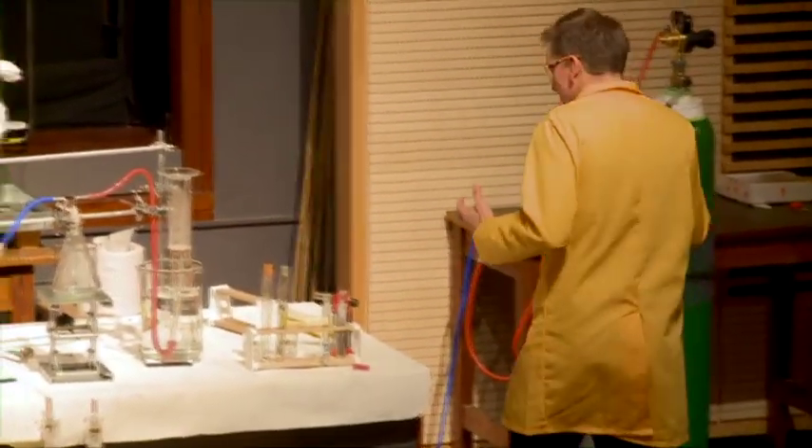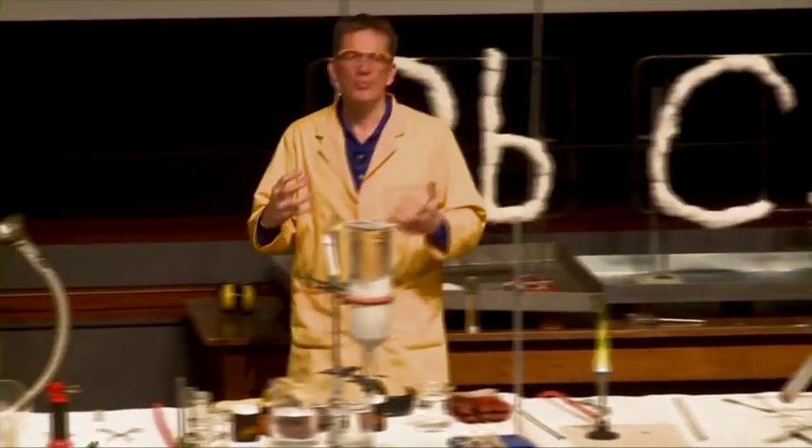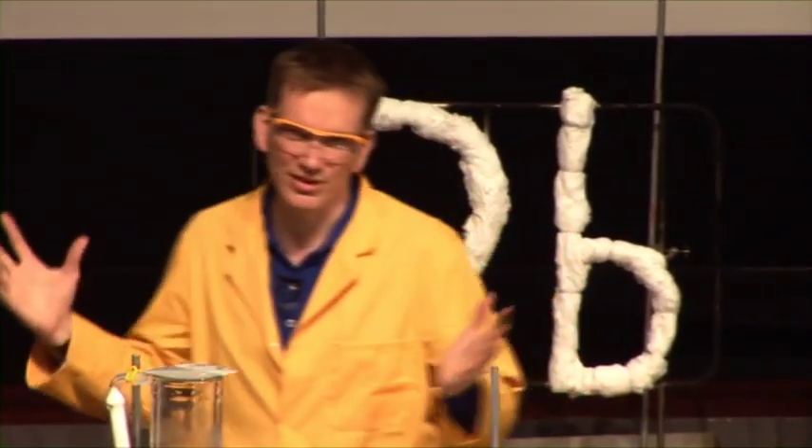I was thinking, what could we get our potassium superoxide to react with? It seems to be reacting with water, but it should be able to — it's got all this oxygen, a surplus of oxygen — what could it react with? And when I was putting the lecture together, I thought, well, what should we have it react with? And there are all sorts of different possibilities.